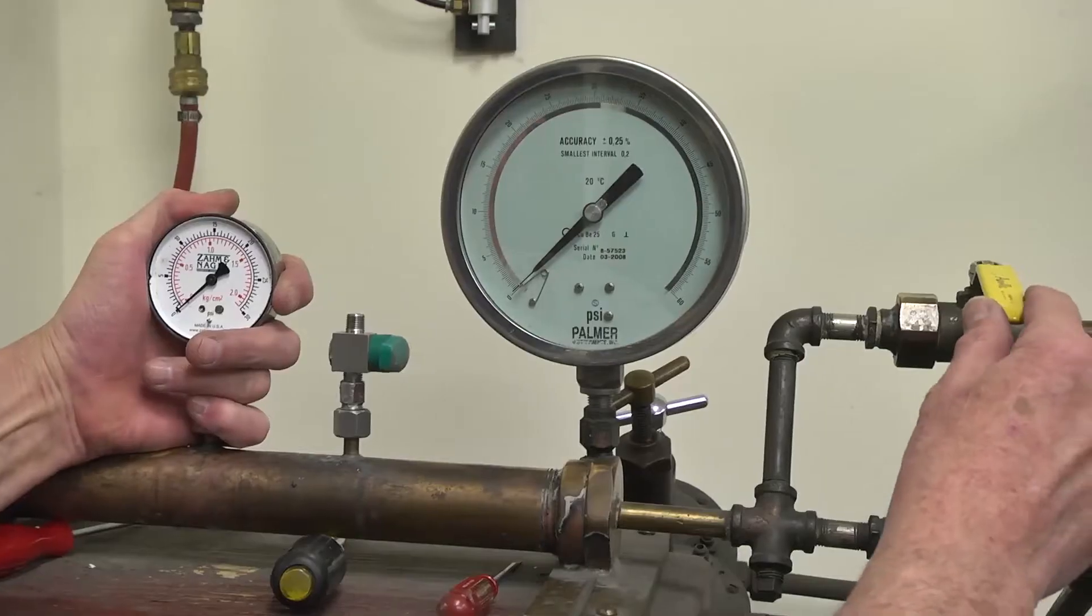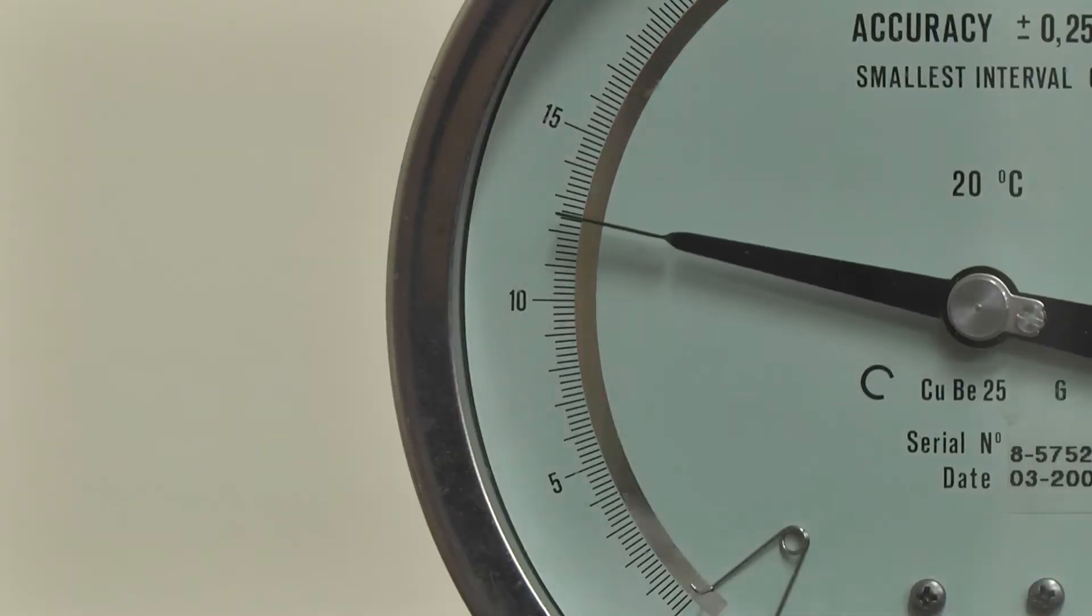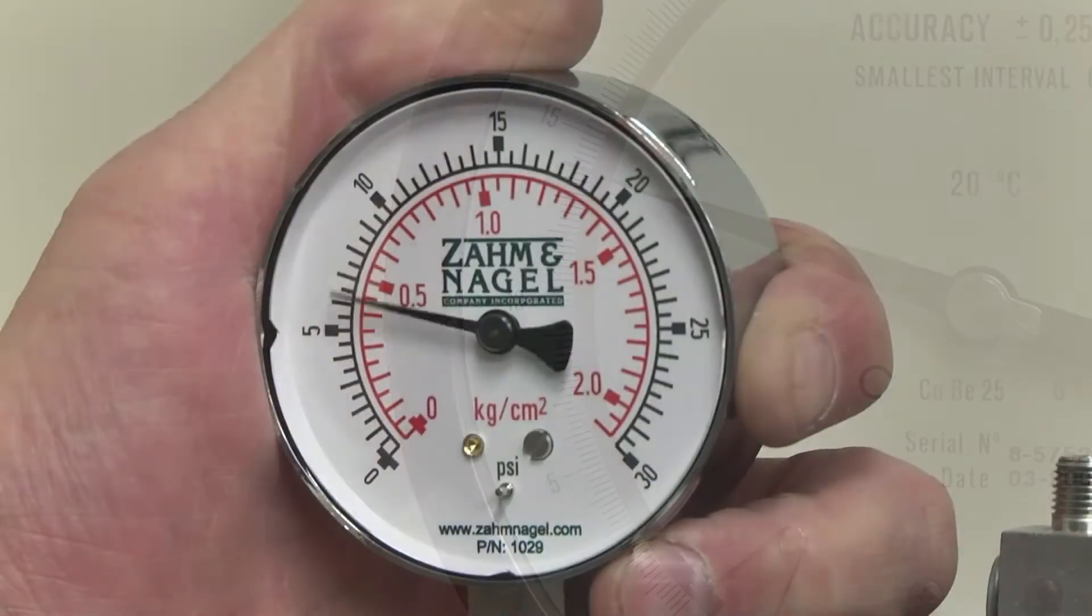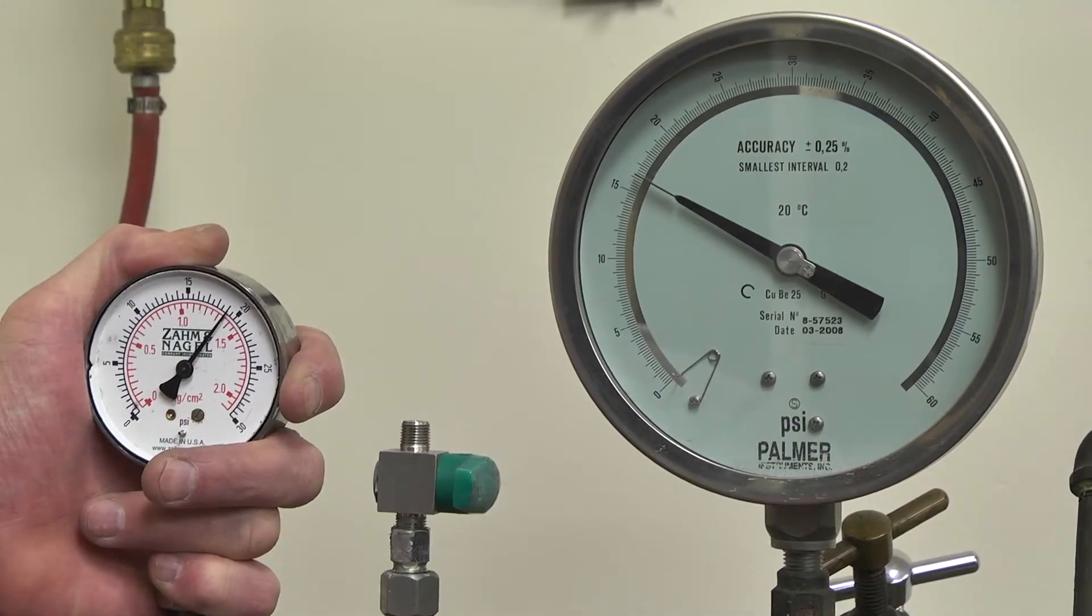Install the gauge on your gauge tester. Establish the pressure in the gauge tester equal to the highest pressure reading you may encounter in the CO2 tester.